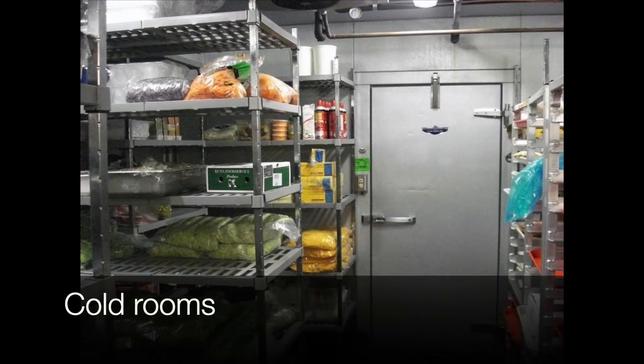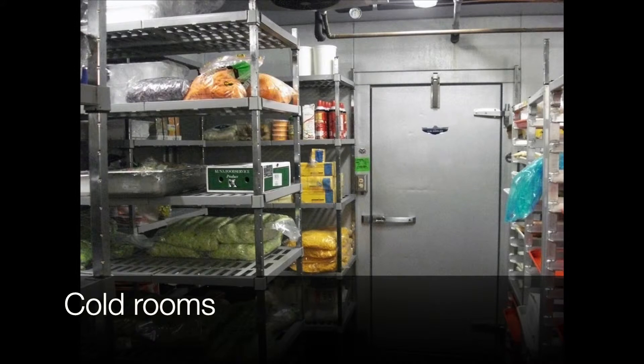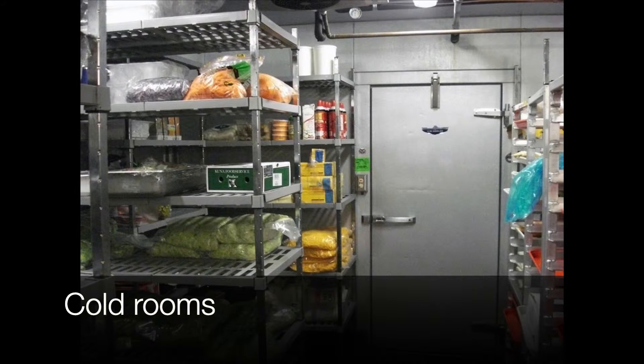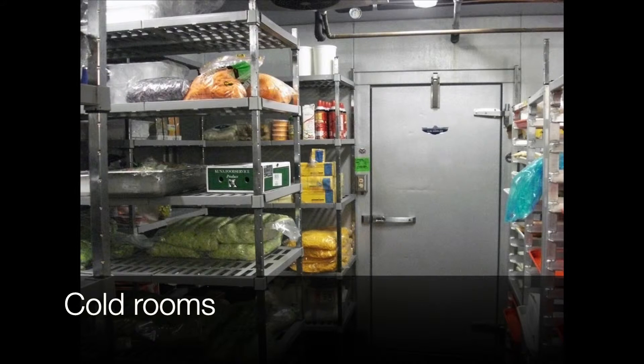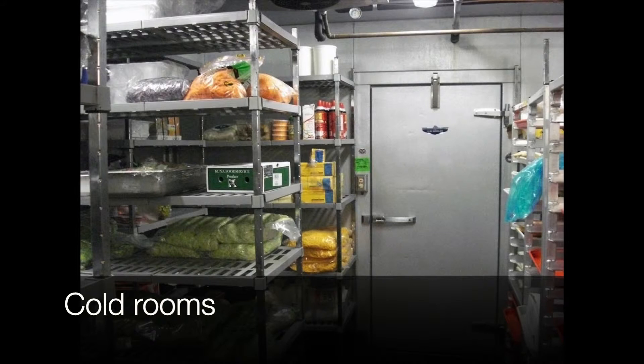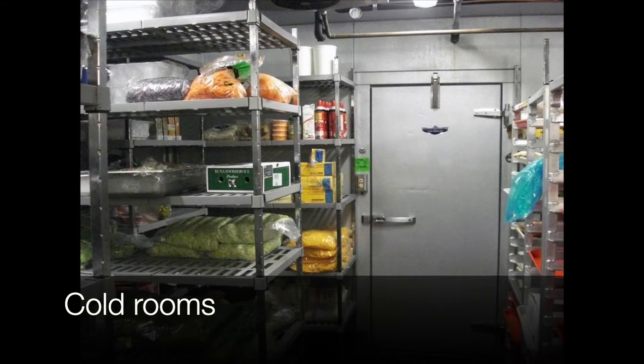Cold Rooms: Here, you should look for condensation on the ceiling, cooling unit drip pans that do not get cleaned regularly, hollow legs of shelves, drains, and door seals. We recommend you take at least two to three samples in a cold room or fridge during a Listeria investigation.